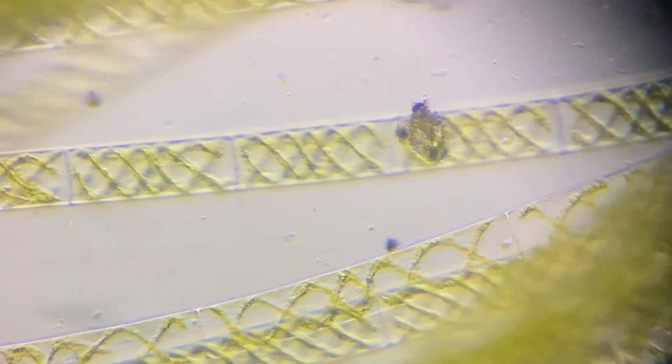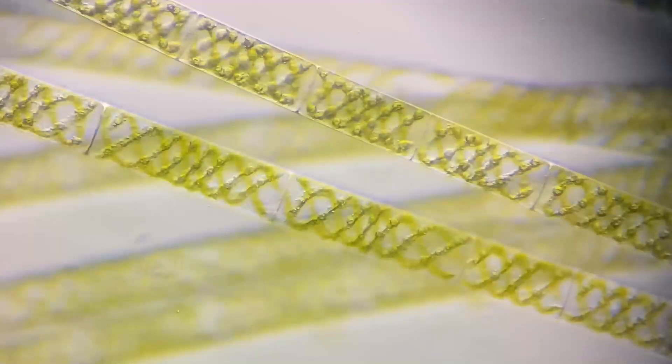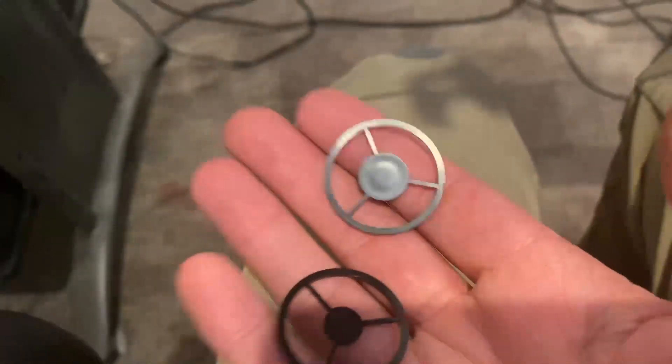This is a cool one — let me go to 40x. It gives me a dark field on 40x. It's got just a little rectangle cut out of it, and that looks nice. At 100x, now I'm getting pure oblique. This is with, and this is without — it just looks better. Do you like it better with, without, or with it halfway in for dark field? These sizes both work well for 40x and 100x magnification.